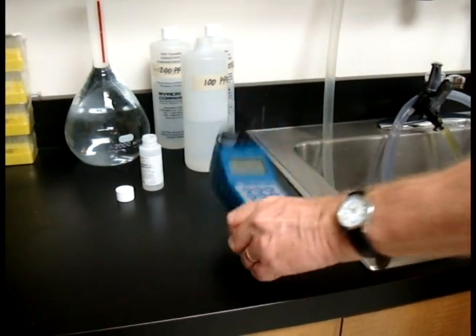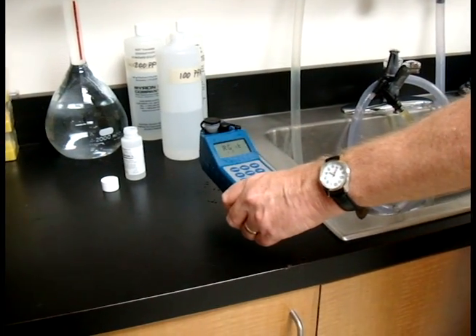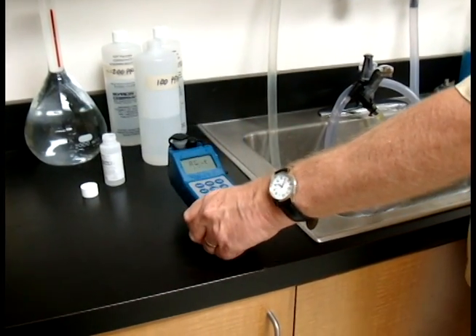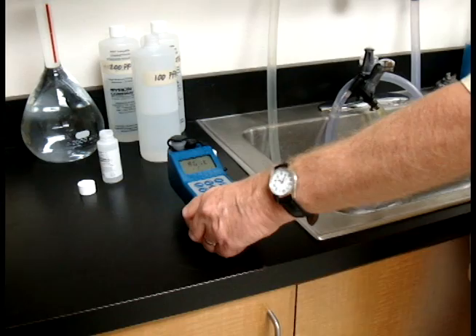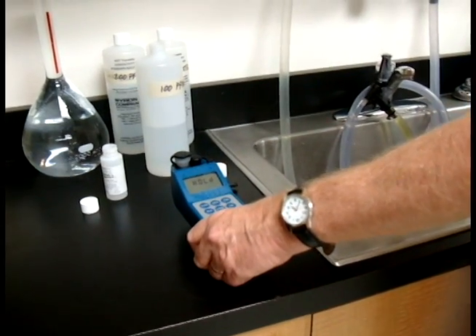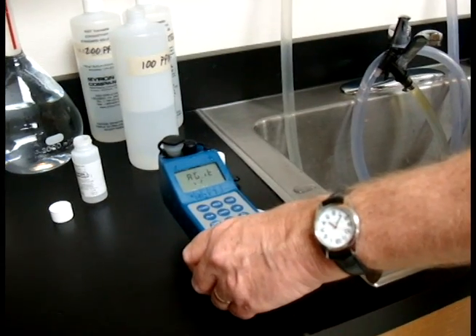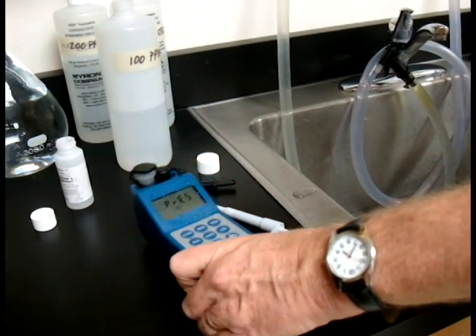Start agitating. Hold. Agitate. Hold. Agitate. Press CAL.